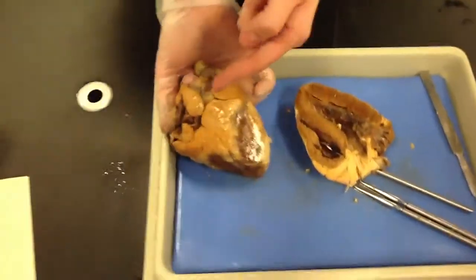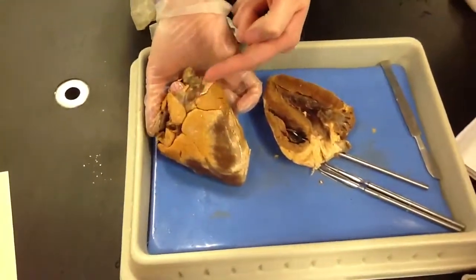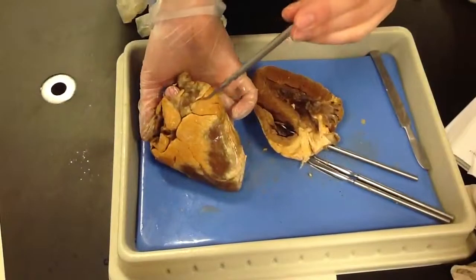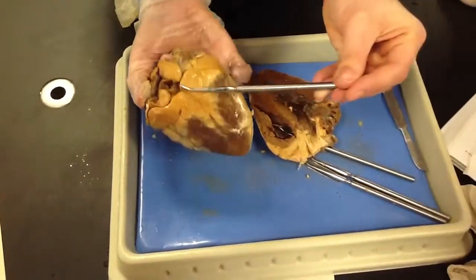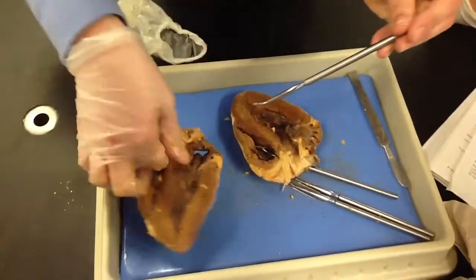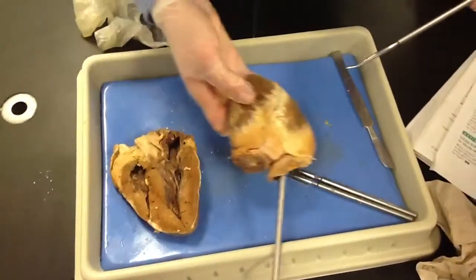So we're finding this. See the sulcus here, how it goes right underneath? It's that one. So we're looking right here. It just looks like these indentations. You can see how they're flowing down, right? Now, the other side.